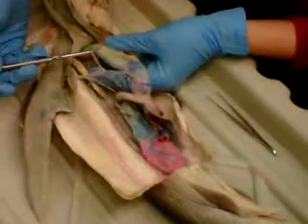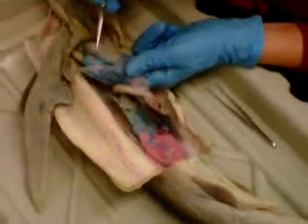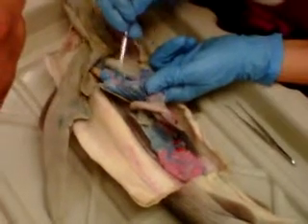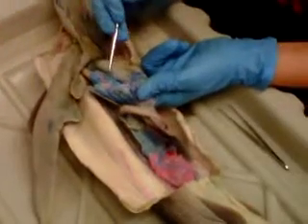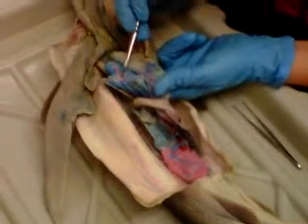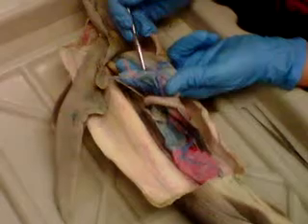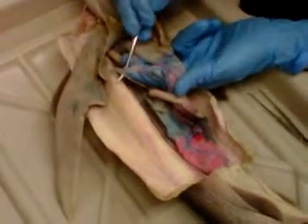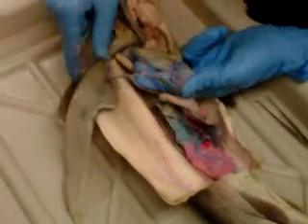This is the celiac artery. It's going to branch 3 times. And here it looks like it branches just like an X, but technically it's supposed to branch first to the gastrohepatic, which would technically be right here, and then further branch into the gastric, which goes into the stomach, and hepatic, which goes to the liver.